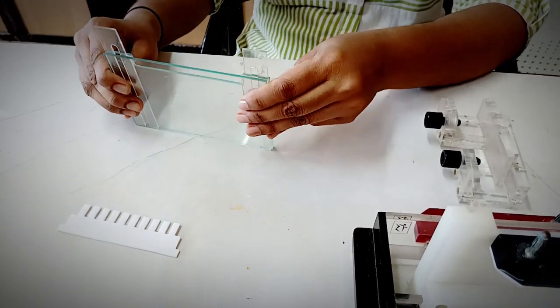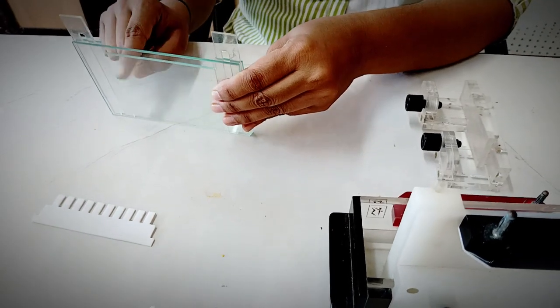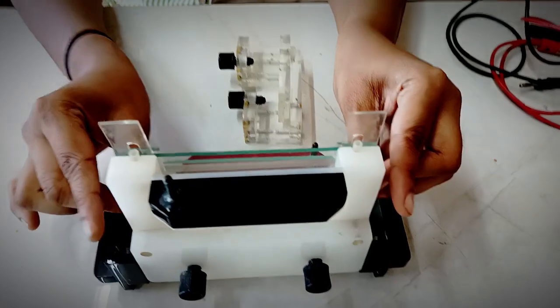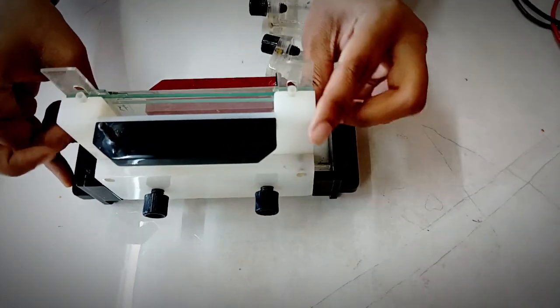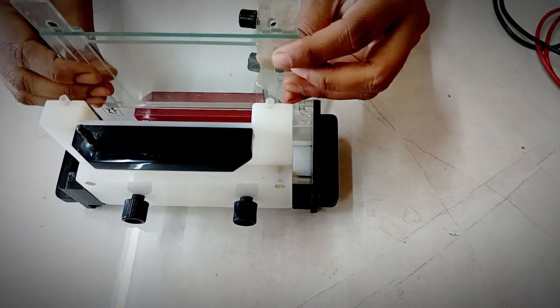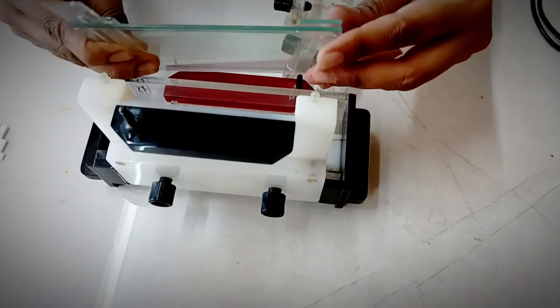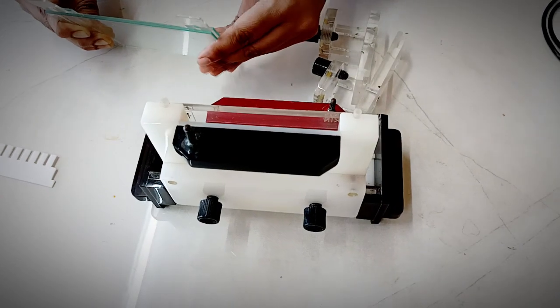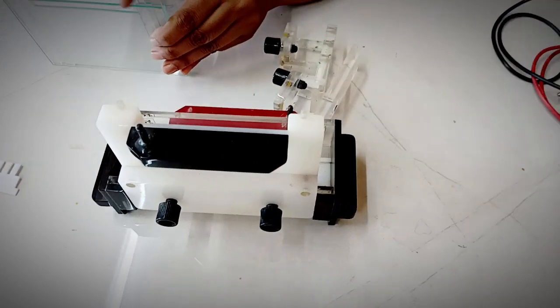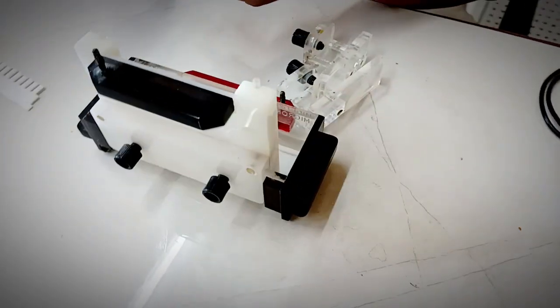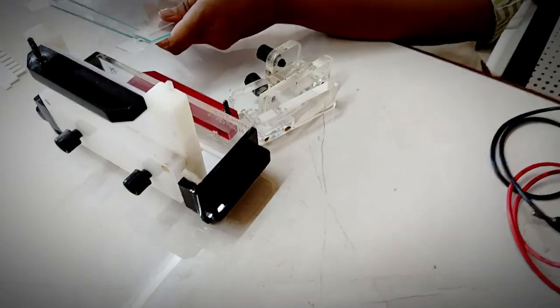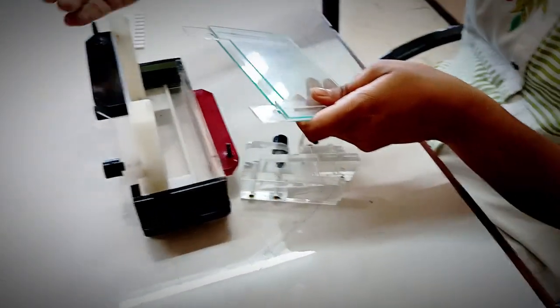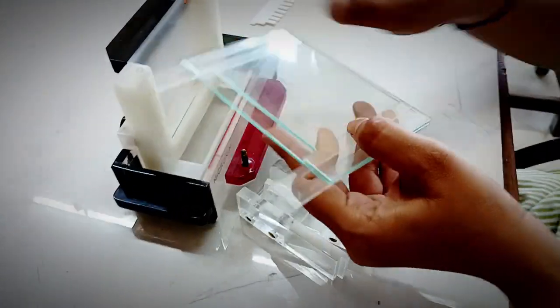You have to do the setup. You have to seal these plates with agarose and then place this setup, this cassette, into the gel apparatus. Now how to place it: in order to perform the electrophoresis, the side which has the notch should be facing inwards, towards the wall.